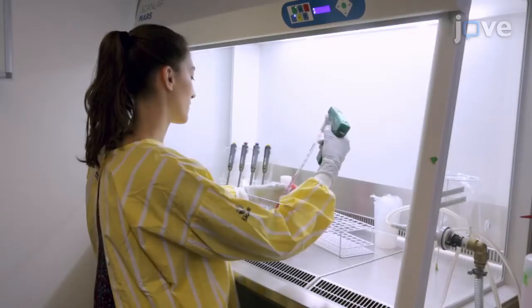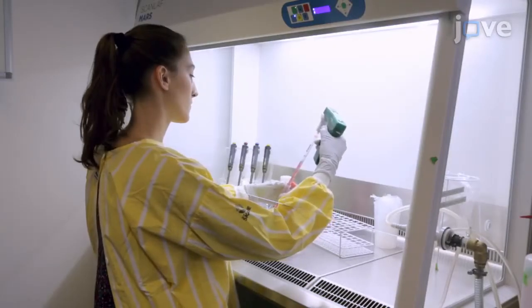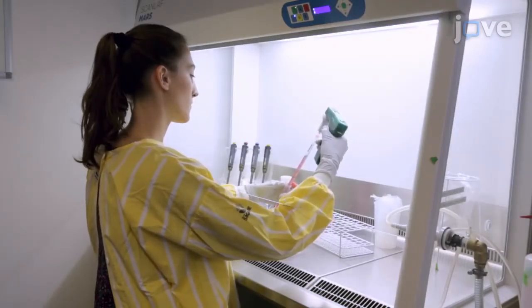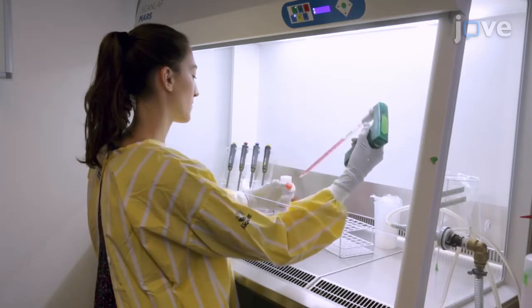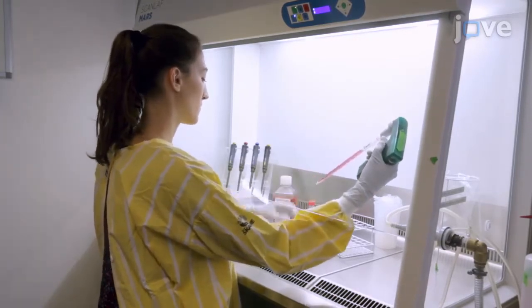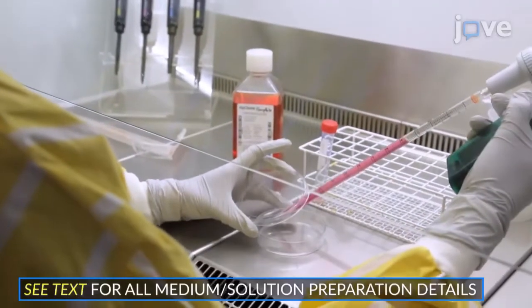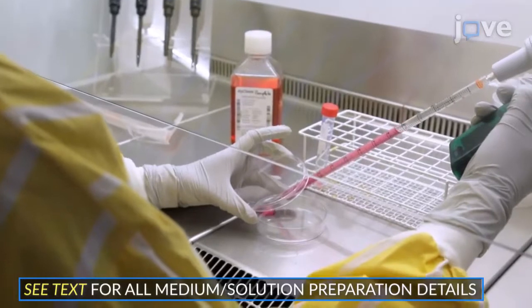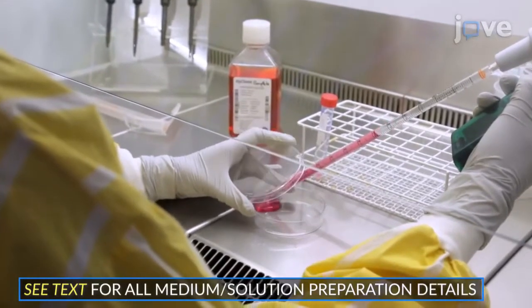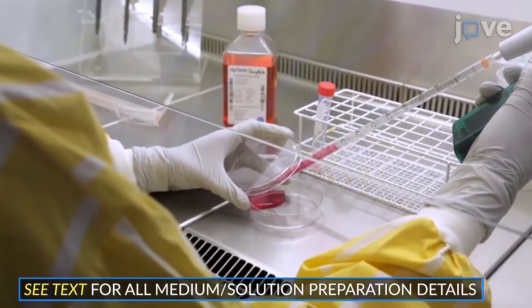Begin by growing HEK-293T cells in a 100 mm tissue culture-treated dish with 10 mL of complete DMEM at 37 degrees Celsius and 5% carbon dioxide until confluency.